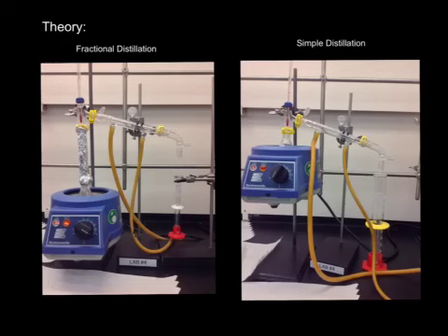Now that we have our materials ready, the student will set up the apparatuses shown right here. For example, on your right, you see the setup for the simple distillation, but on your left, you see the setup for the fractional distillation. But before we get into the comparison between the two, I'm going to talk a little bit more about distillation.